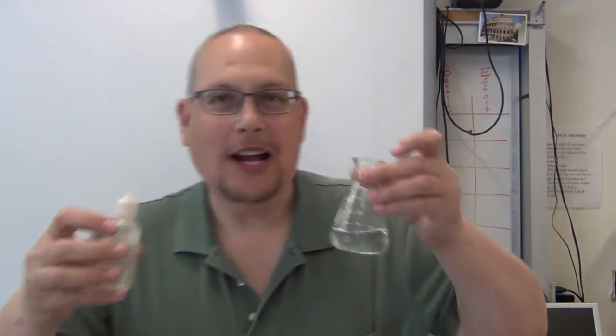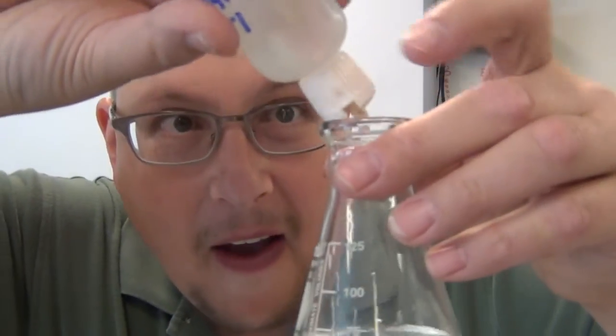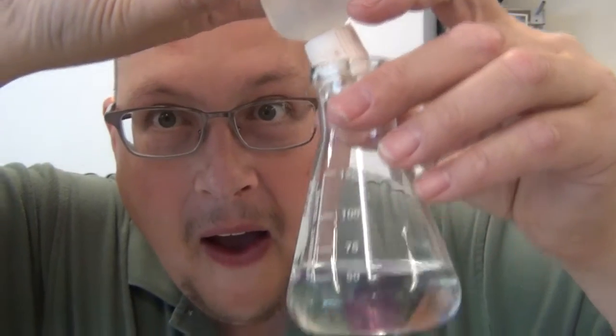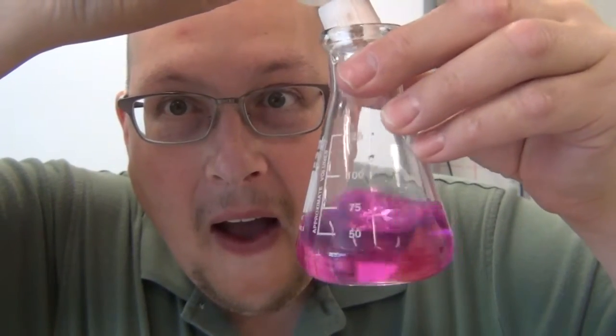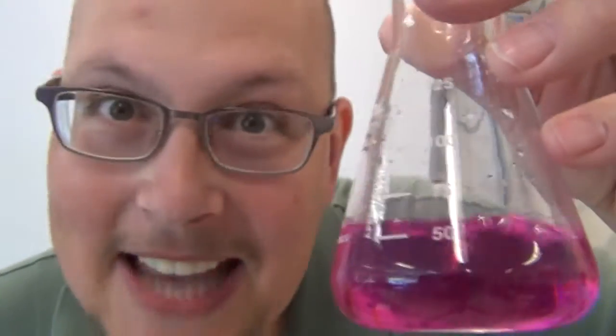Now, to this neutral water, we're going to add some sodium hydroxide. Watch what happens. Isn't that pretty? Nice pink color for the phenolphthalein.